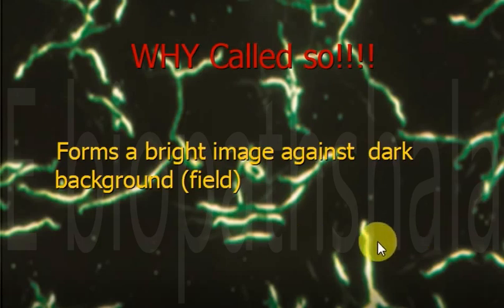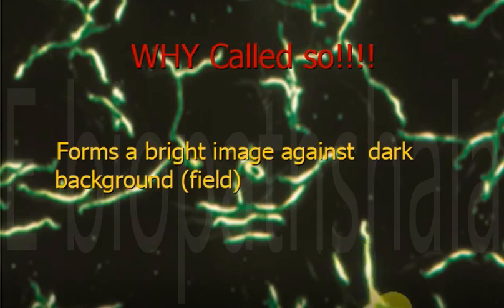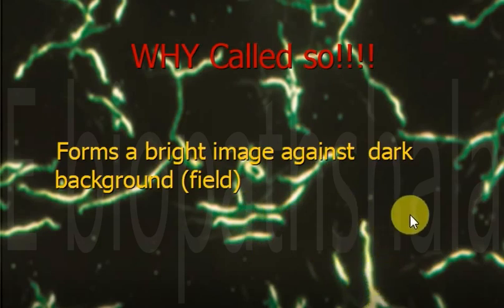Dark-field microscope is one of the microscopes in which bright images are formed against the dark background. Why is it called dark-field microscope? Because here a bright image is formed against a dark background or dark field. We can see in this image that a bright image is formed against a dark background.